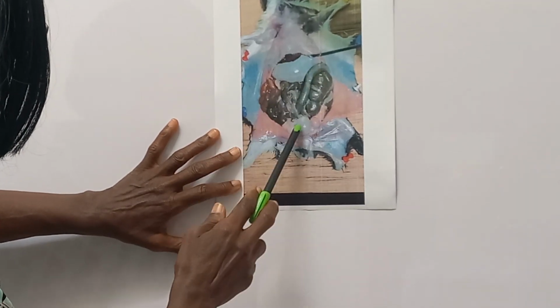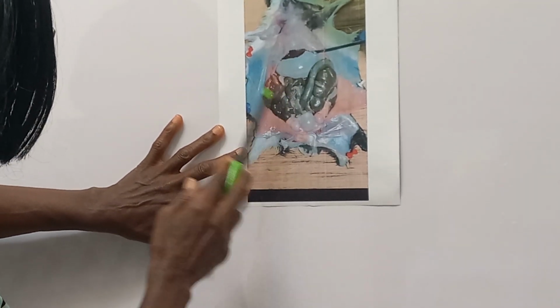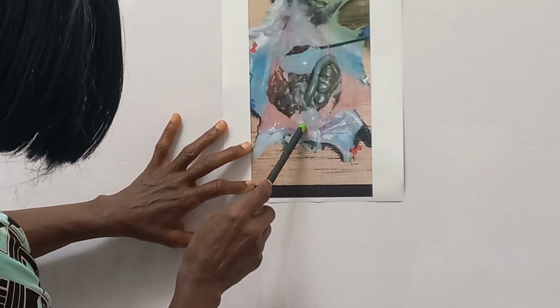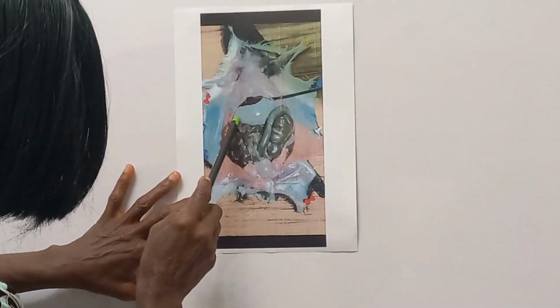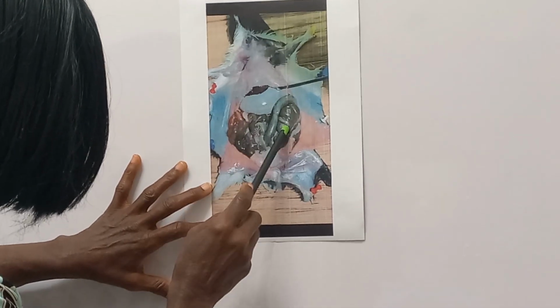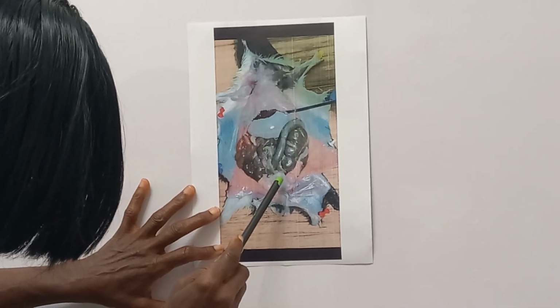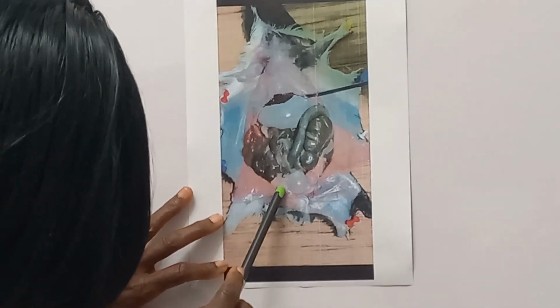Here is the abdominopelvic cavity in situ. Now, in the abdominopelvic cavity, we see the stomach, liver, large intestine, small intestine. Then we see the urinary bladder, and the testes.